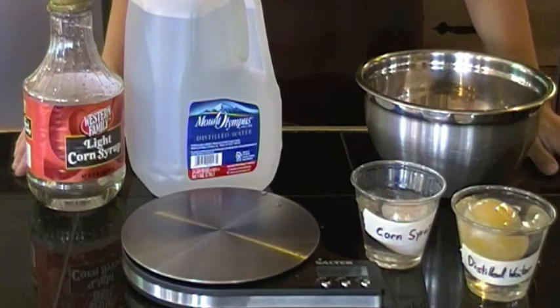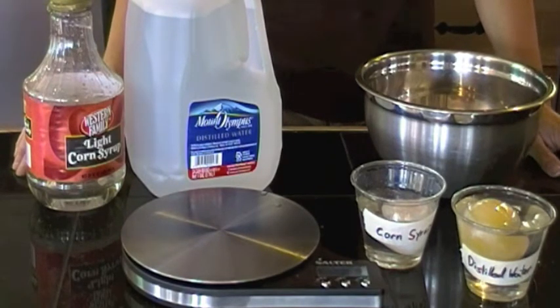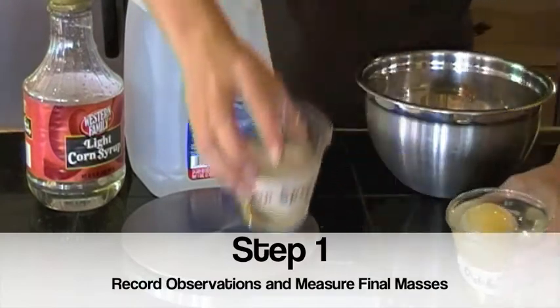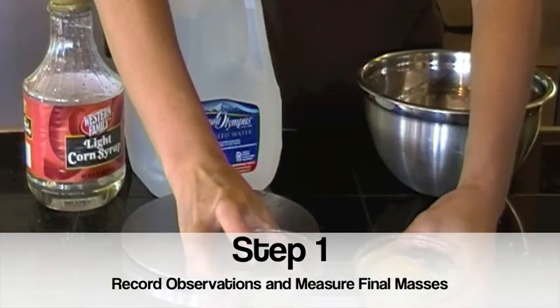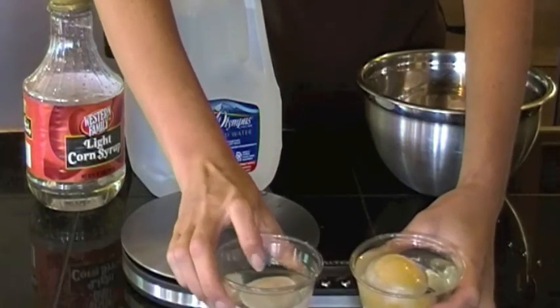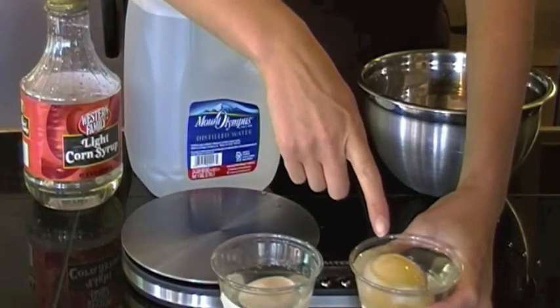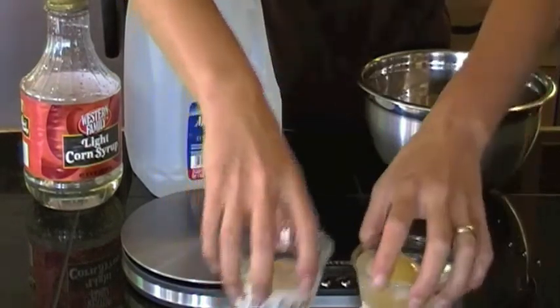Welcome back to the third and final part of our osmosis and diffusion lab. Today we're going to record our final observations and the final masses of our eggs. Be sure to record your observations of each of the eggs in our lab. You'll notice that the corn syrup egg here has shrunk, whereas the distilled water egg here has grown.